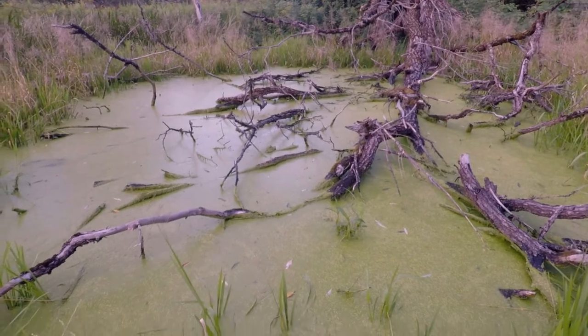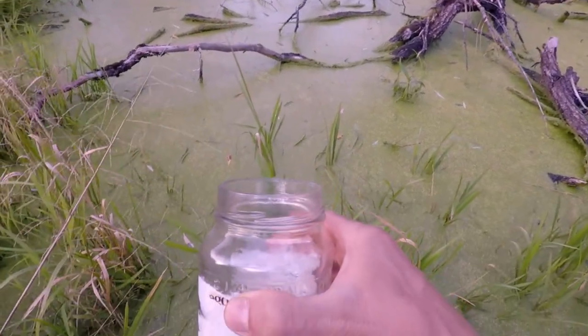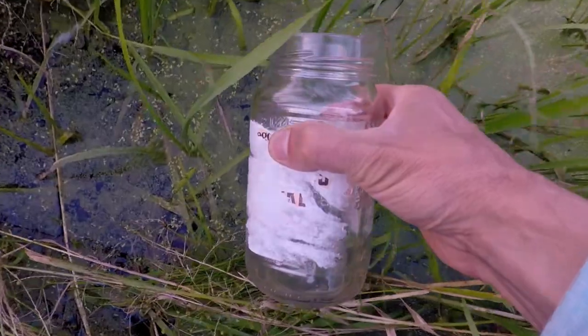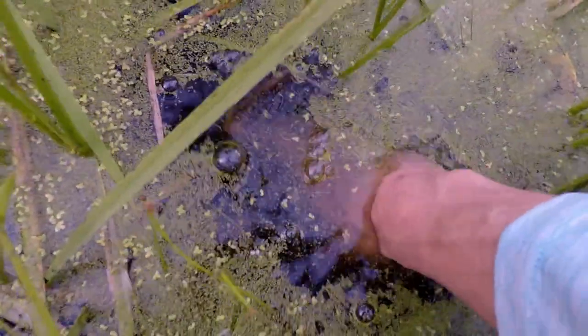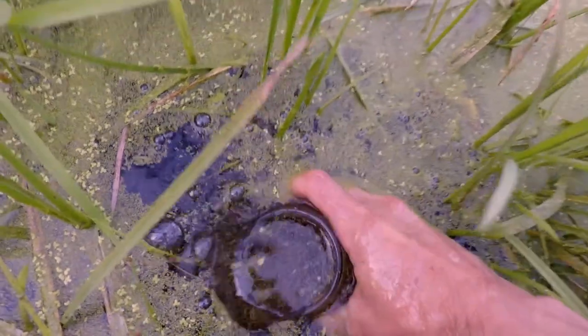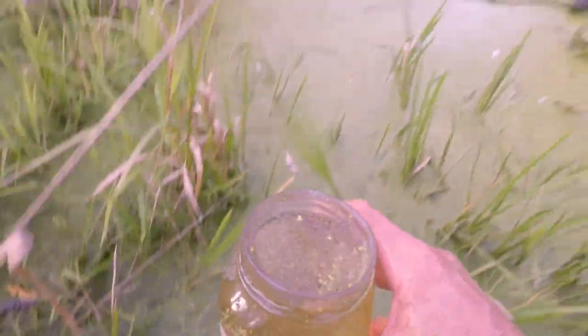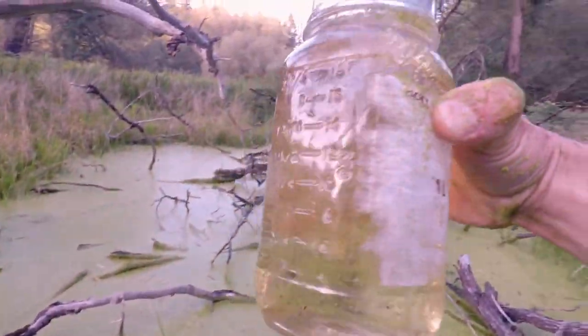What I like to do is find the nastiest water around and then get the nastiest of the nasty water by getting the stuff at the very bottom and placing that under the microscope because there are some really neat things that live in nasty water.